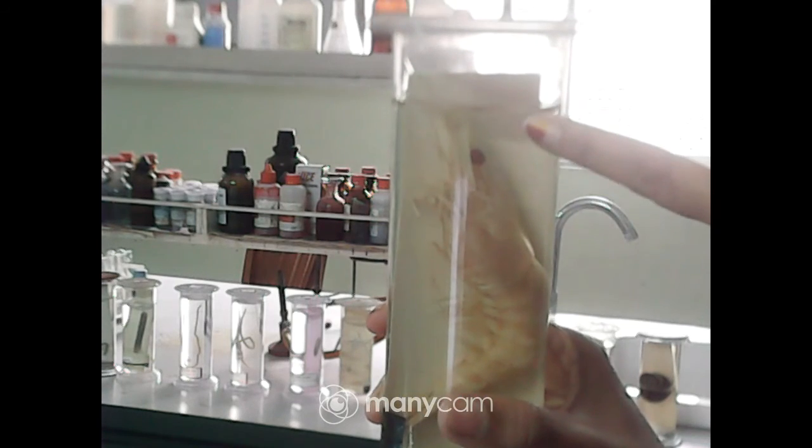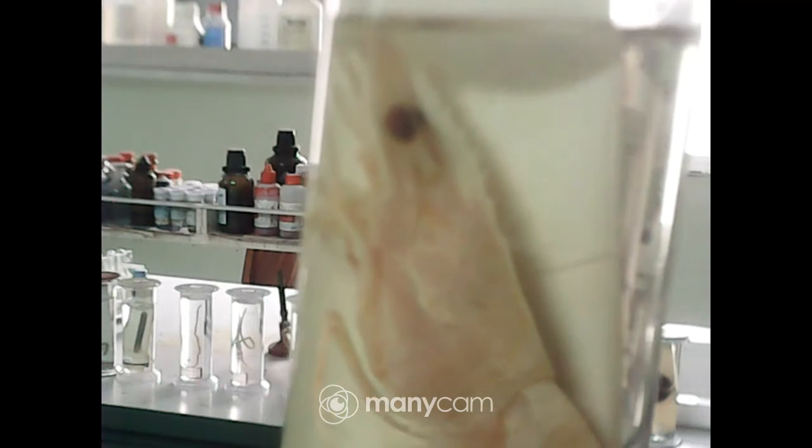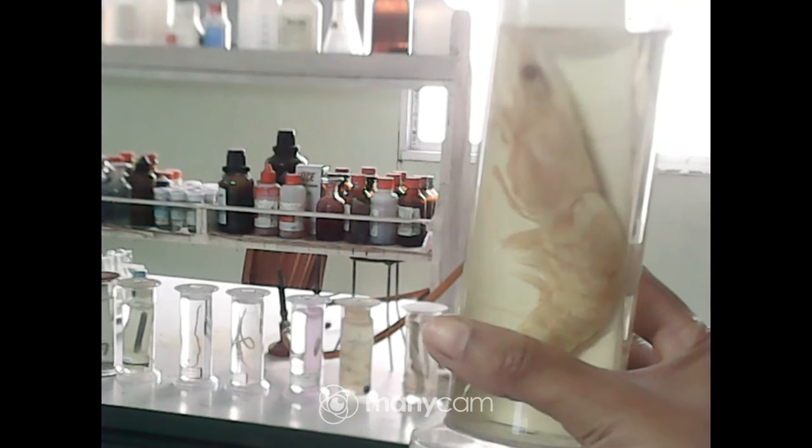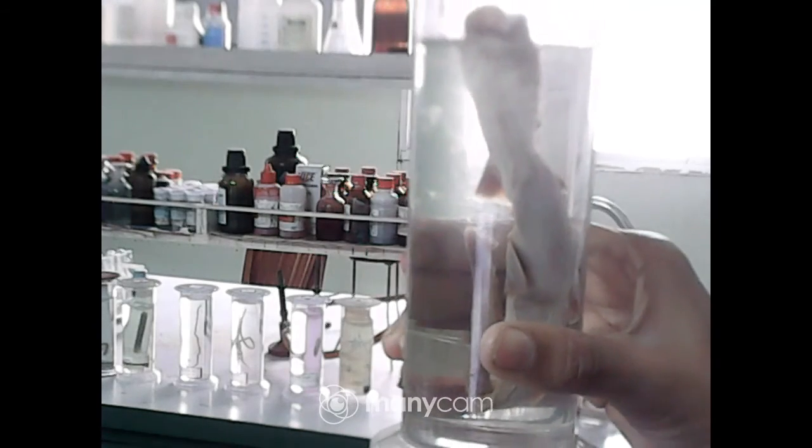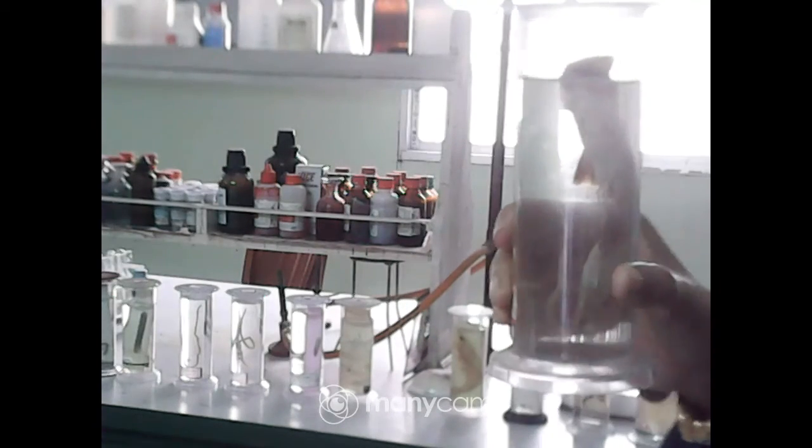Here you can see the rostrum of the prawn — this part is the rostrum.